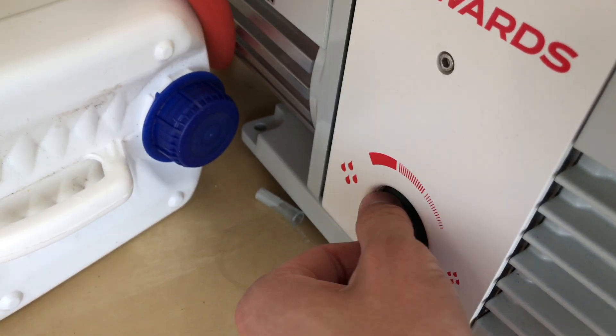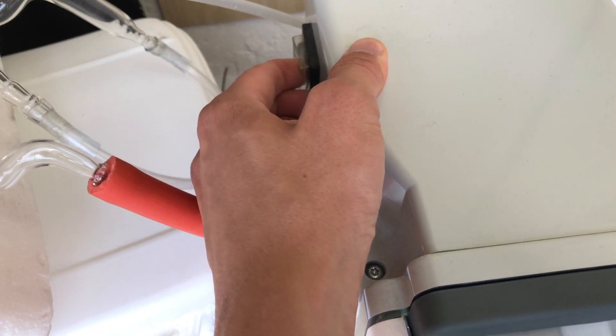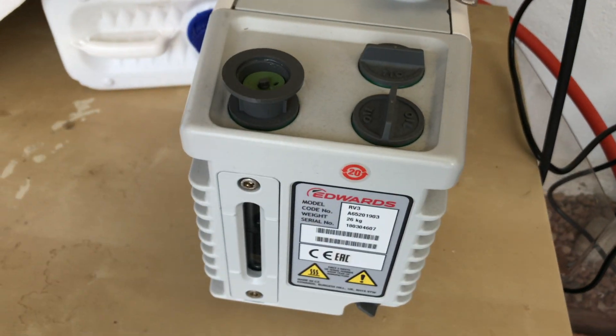There's certainly leftover benzene in our reaction mixture and I don't want that to end up in my pump oil and in the atmosphere. Therefore it's going to condense and solidify in these cold traps and it's not going to mess with my pump.